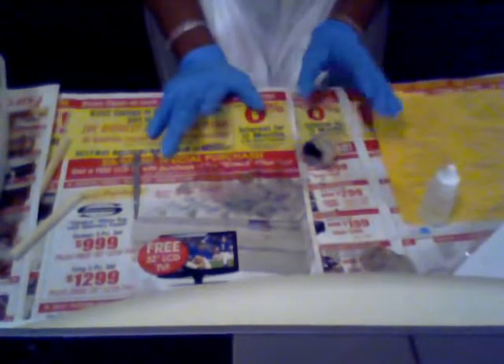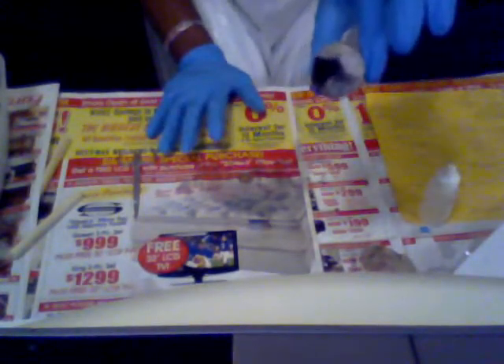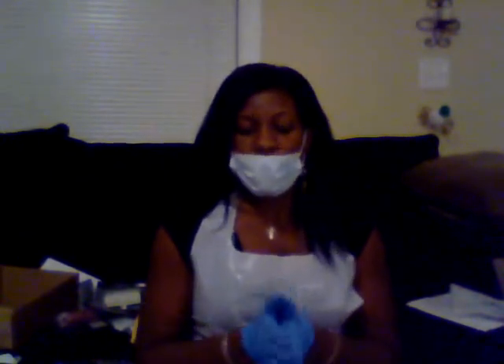That is my eye dissection — the parts of the eye. I hope I covered everything. This was really actually interesting; I really kind of enjoyed myself doing this. It wasn't as bad as I thought — I thought I would be a little bit freaked out, but it wasn't so bad at all. I was thinking there would be blood and stuff, and I get a little queasy, but it was fun. Thank you, and that's my eye and my brain dissection video. My brain dissection video is on another link, but I'll send you both links.